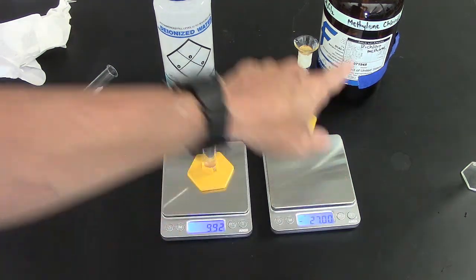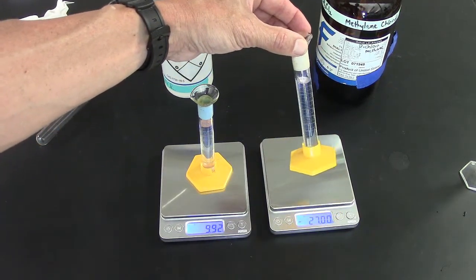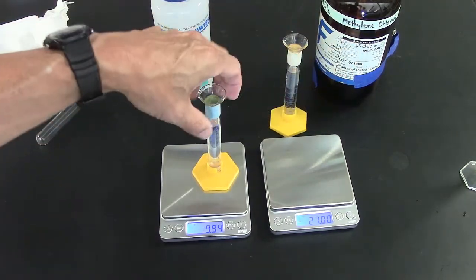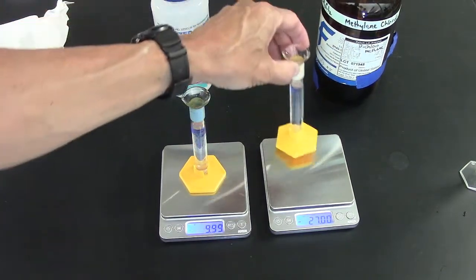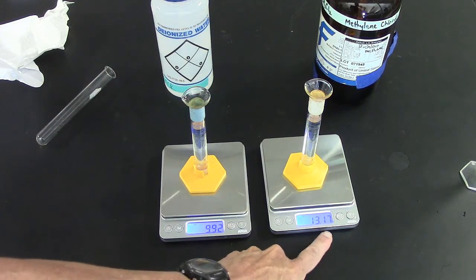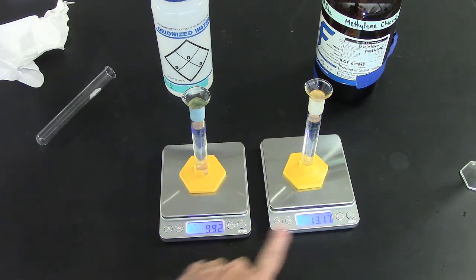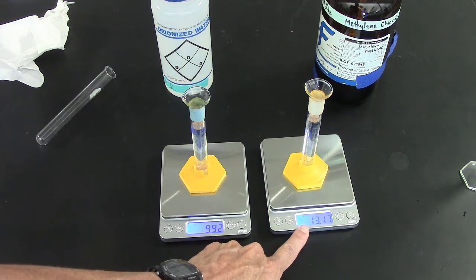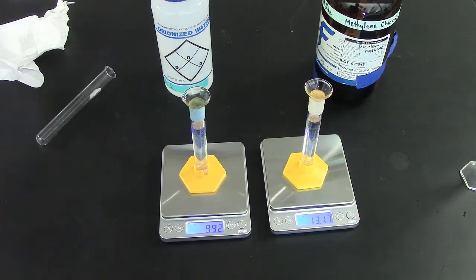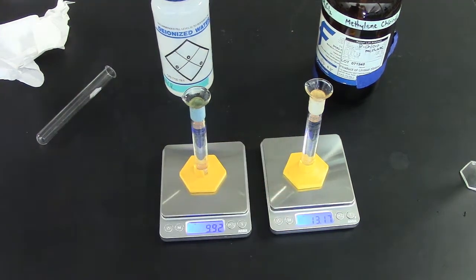On the other side, I filled this cylinder also with 10.0 milliliters, but it's not water. It's methylene chloride or dichloromethane. You can see the mass here is much higher. Equal volumes, unequal masses. The dichloromethane is more dense, a higher density, more grams in the same volume.